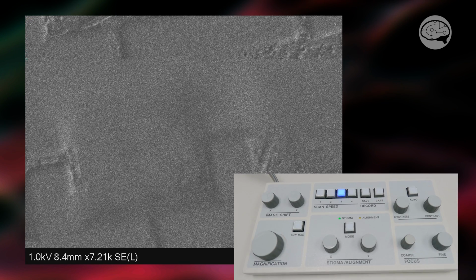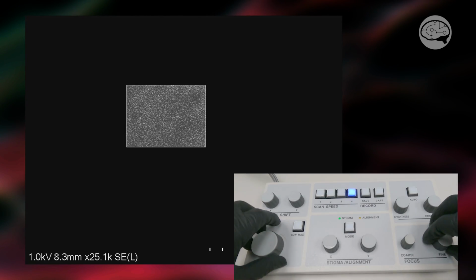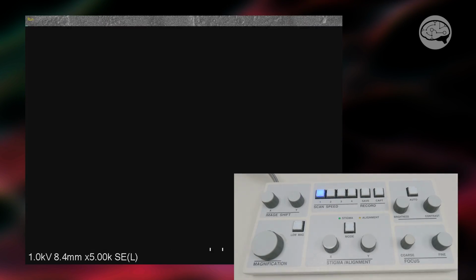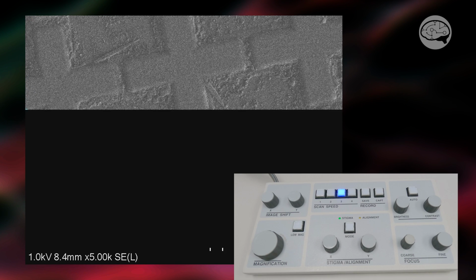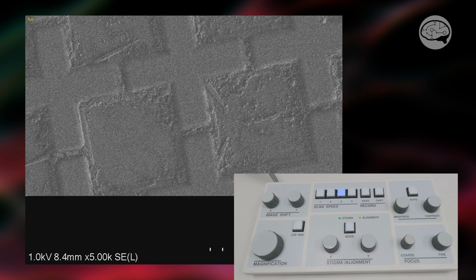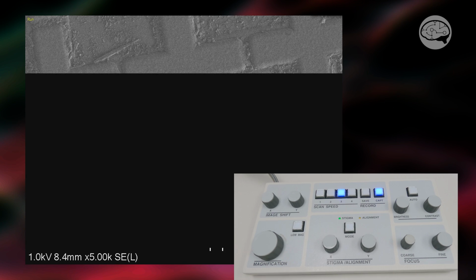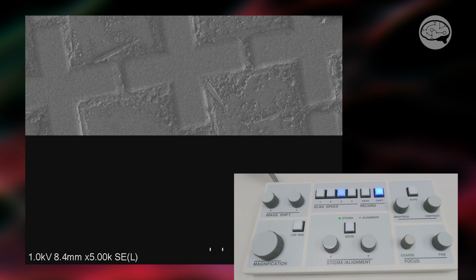Now, if I go to a reduced scan box, I can go up in magnification, and we can see some little structures here. And now we can actually focus this pretty well. But starting off from scratch, this was just not doable at all. Now, this is really helpful if you're dealing with very poor signal to noise, maybe with a backscatter detector or any other sample where you have to run the microscope like I'm running it right now in this very low current mode. I'll go ahead and capture this image just for fun, but you can see how very quick and easy this was to start off from super noisy, super horrible, totally unusable image into, hey, now it's in focus.